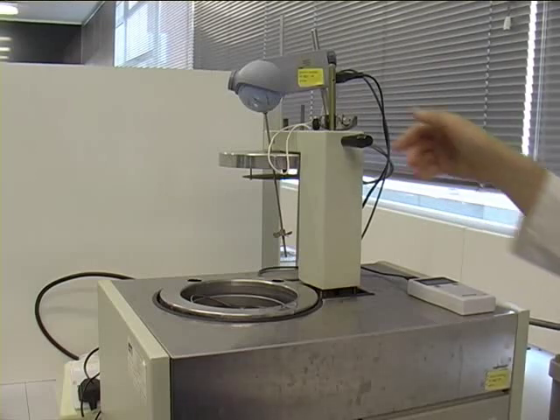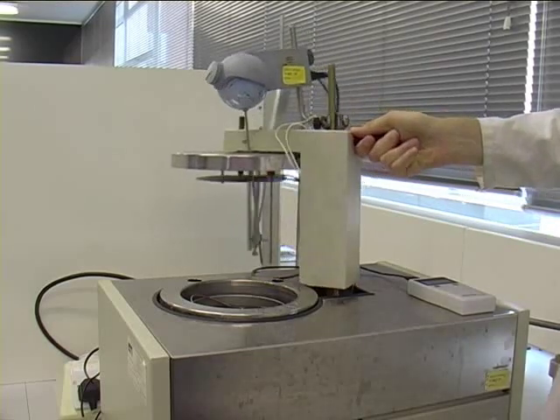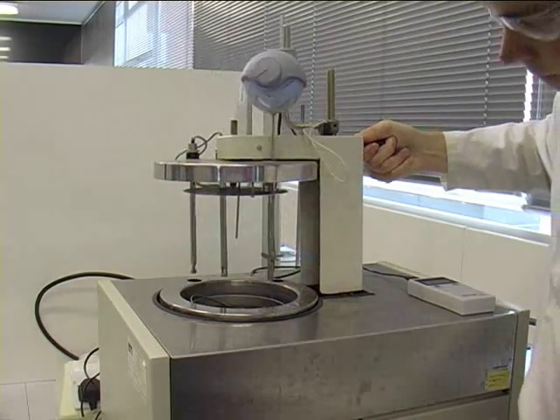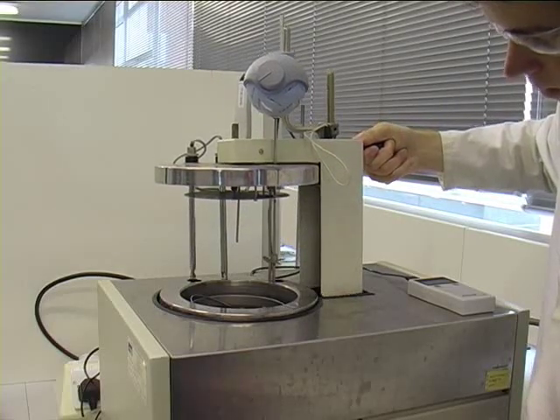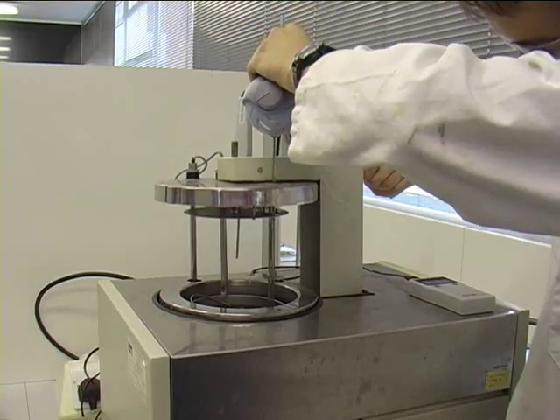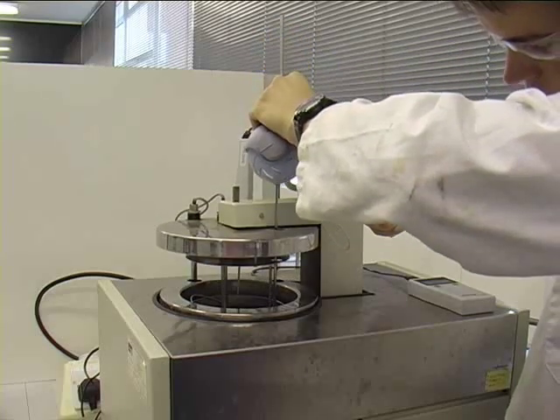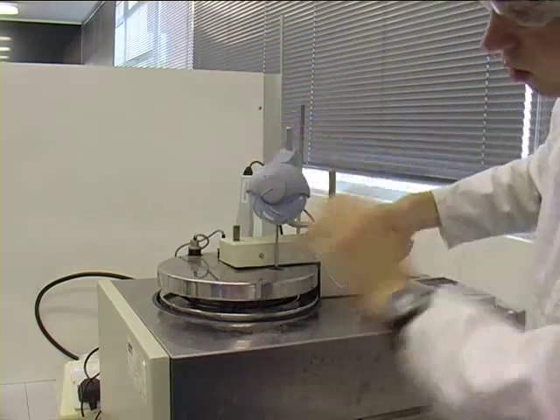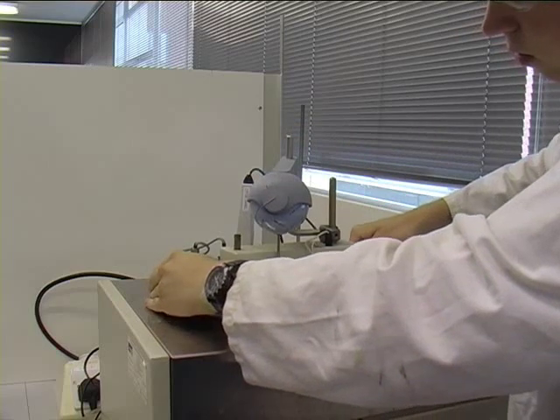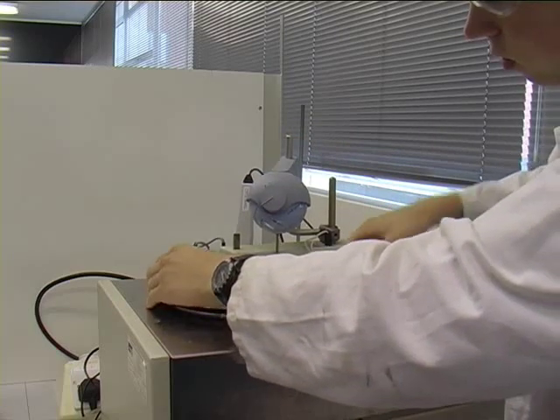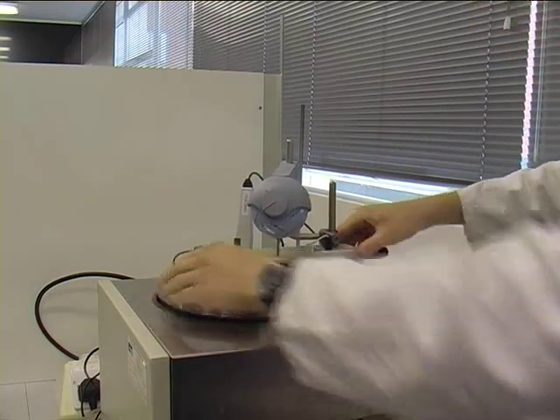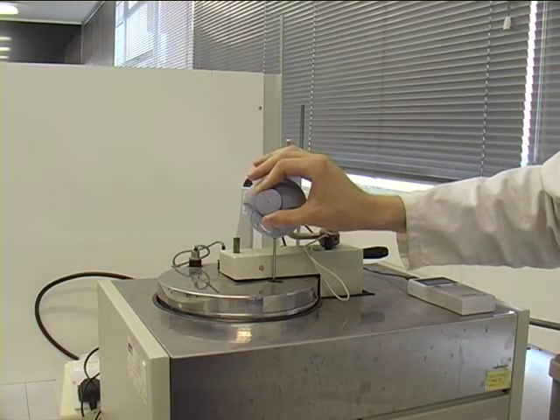The lid of the calorimeter is closed. The stirrer is turned on and the black button at the centre of the calorimeter pushed down. If a good contact is made, it will stay down once pressed.